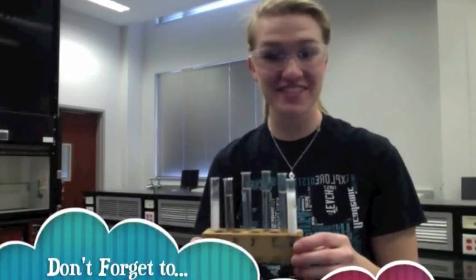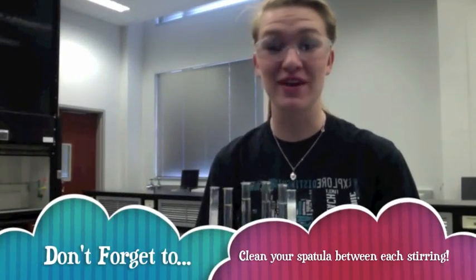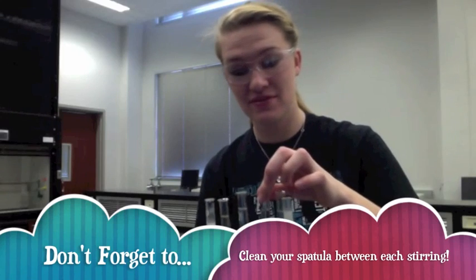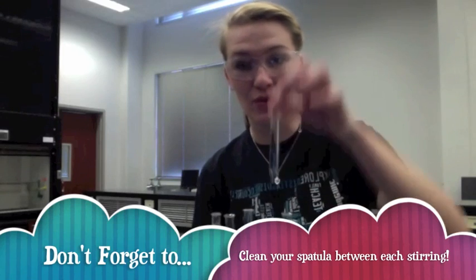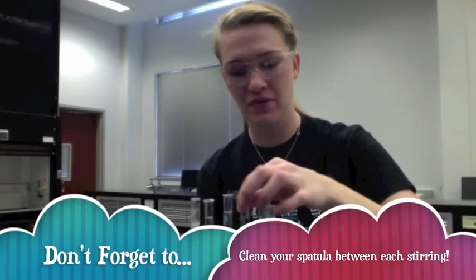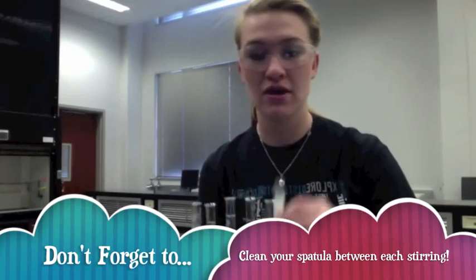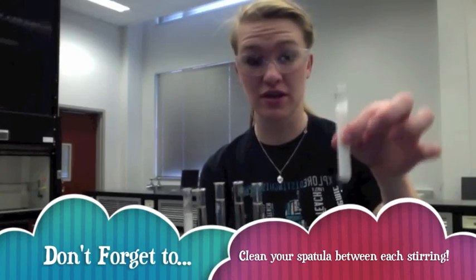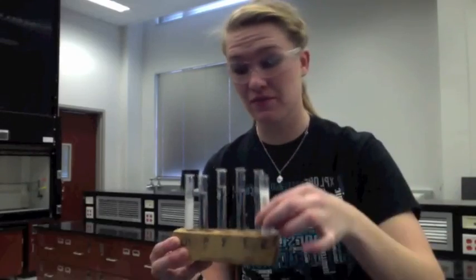After this first test, we will have two clear categories: water soluble, which produces a completely clear liquid, and water insoluble, which will result in a cloudy liquid.